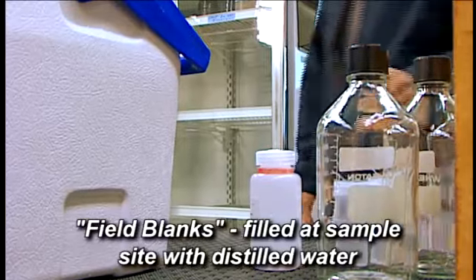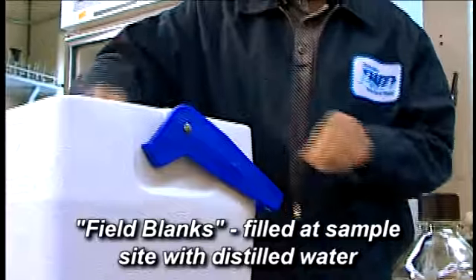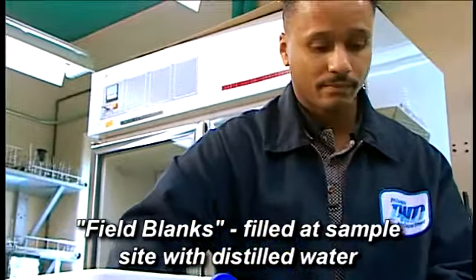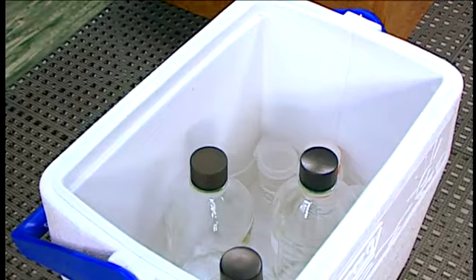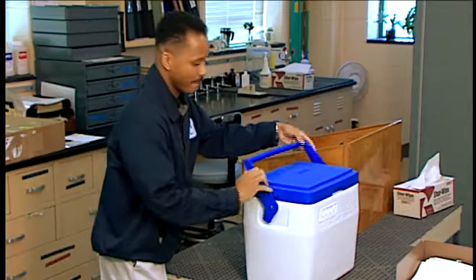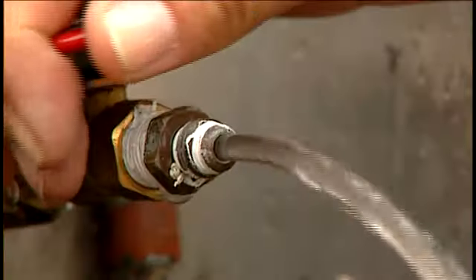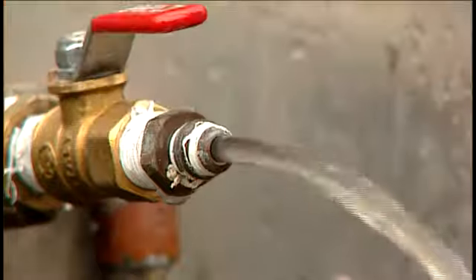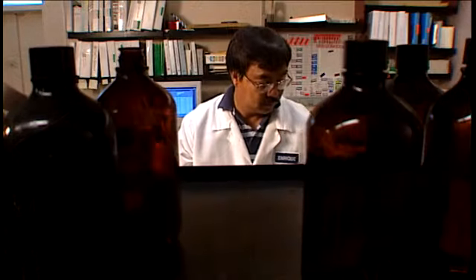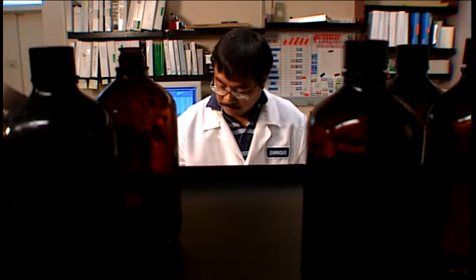Field blanks are analyzed for the same reason but are opened or filled at the sampling site with store-bought distilled water. All samples and blanks should be transported cautiously to avoid breakage or leaks. Carefully controlled water sampling is important to assure accurate test results used to assess a community's water quality.